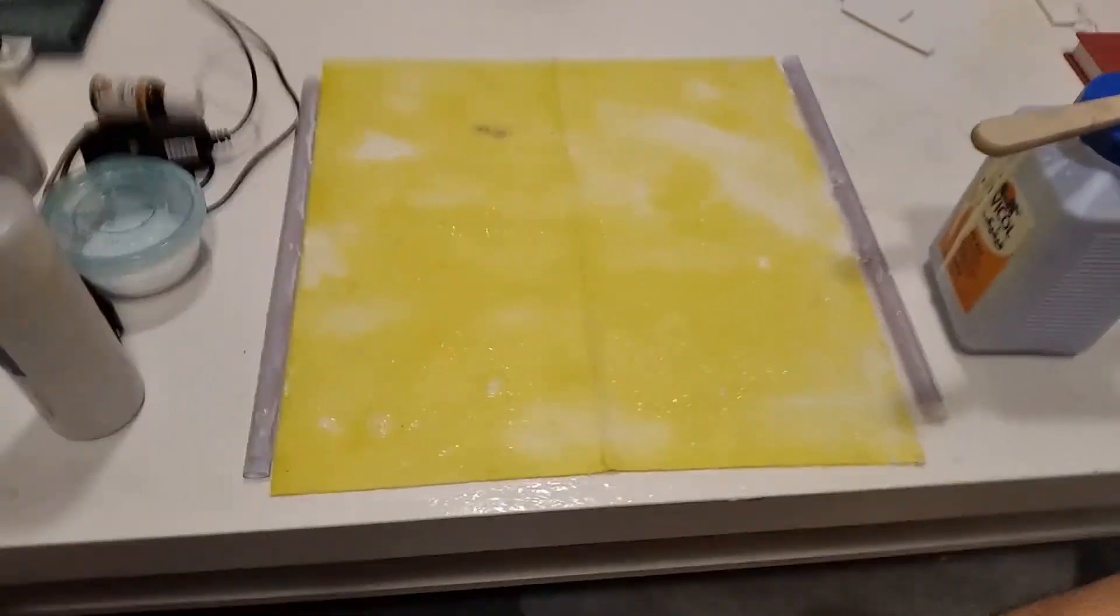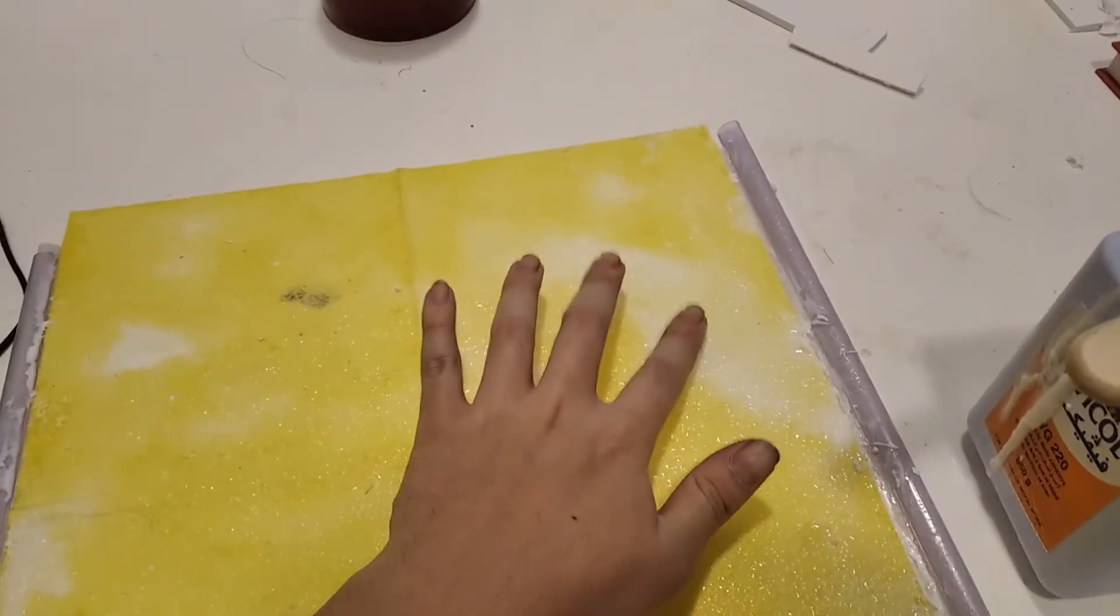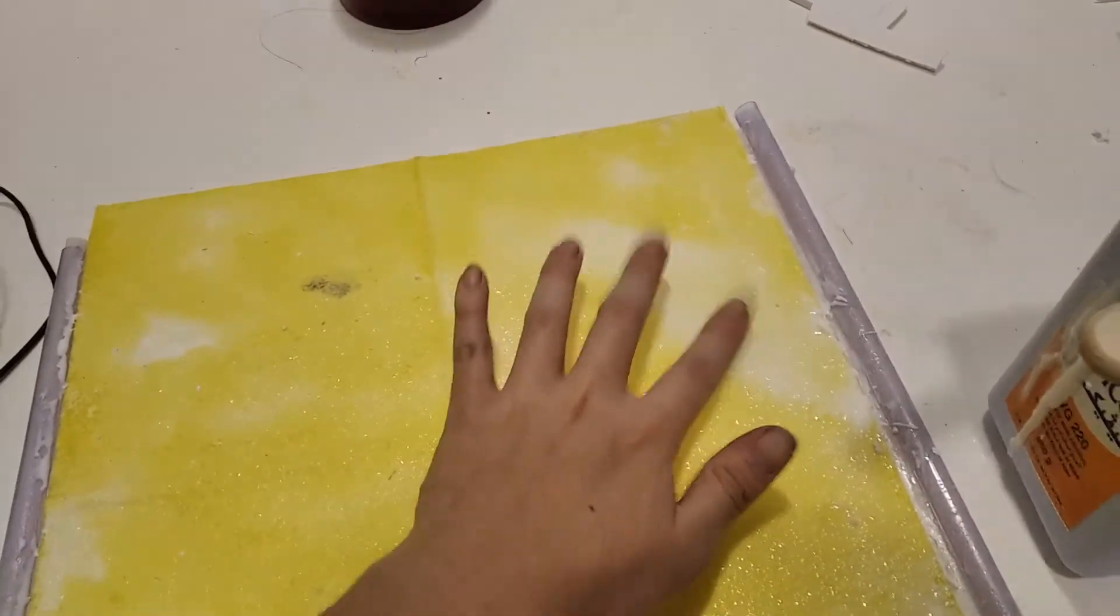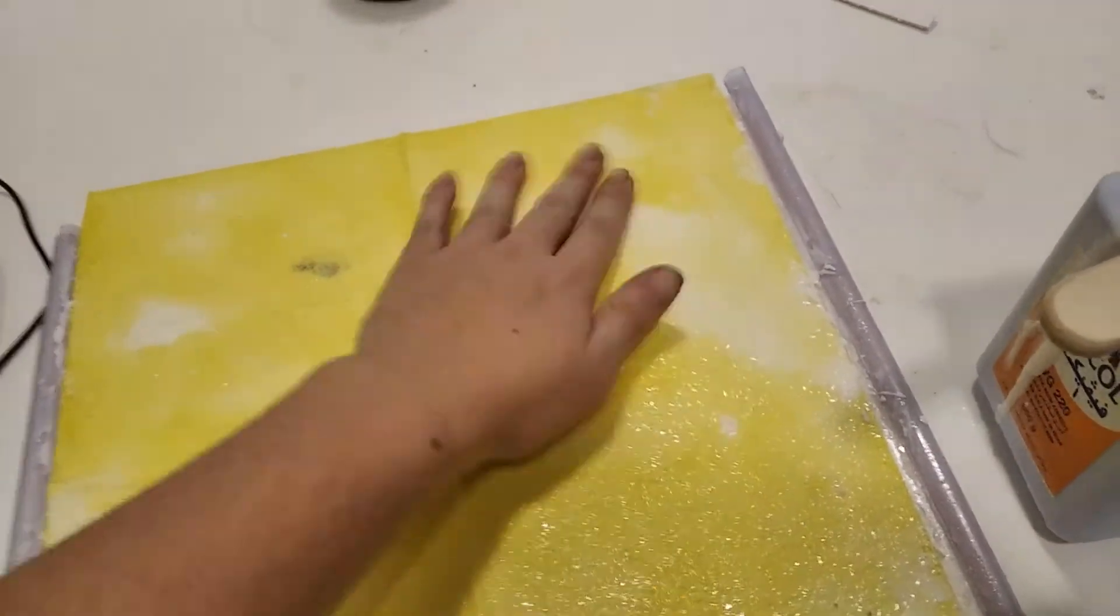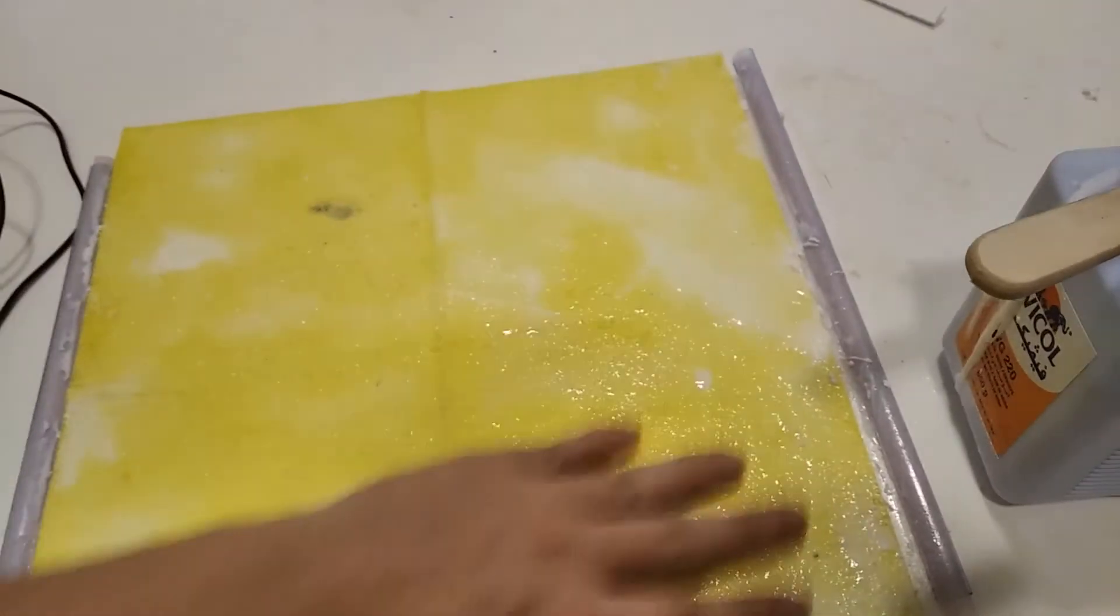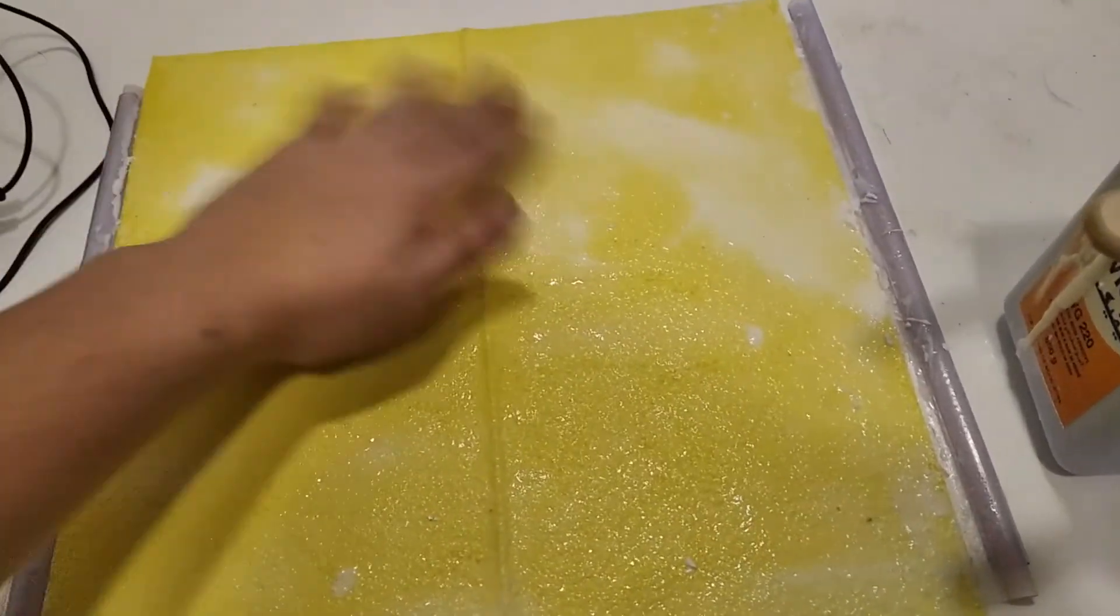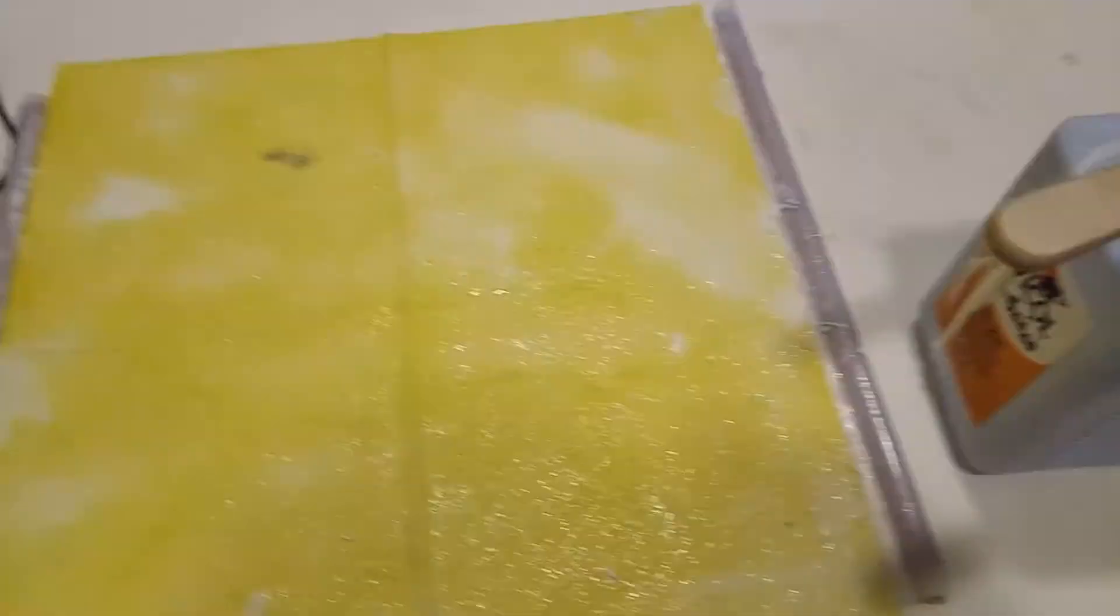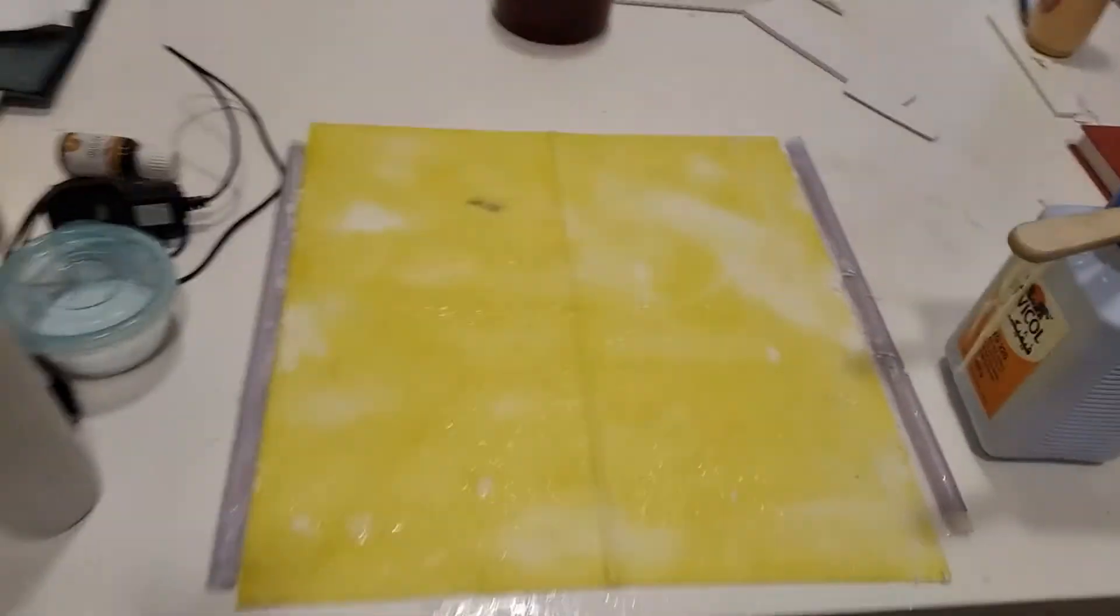You have to let this dry afterwards. After you've sprayed it clearly, it is no longer sticky. You can also move your hand across it fairly easily. Now you want to take this sheet and dry it.